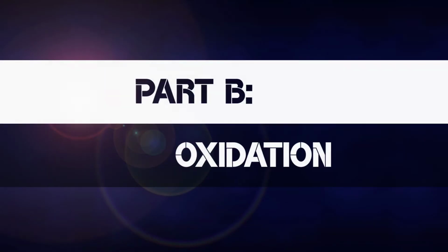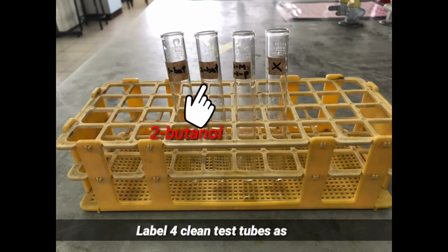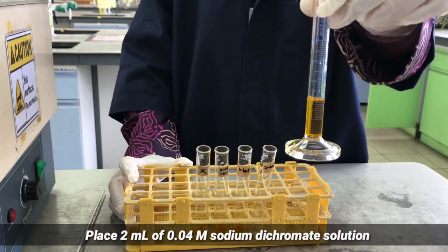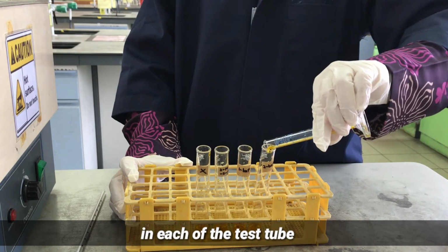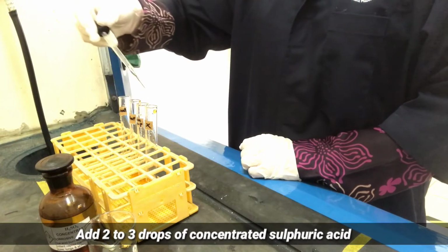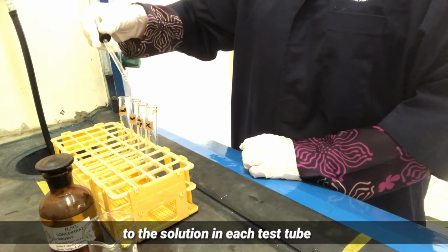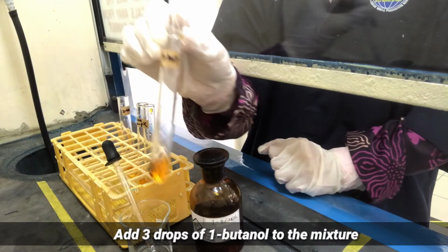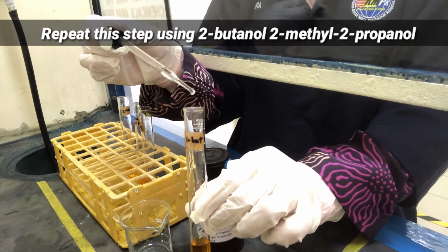Part B, oxidation. Label 4 clean test tubes as 1-butanol, 2-butanol, 2-methyl-2-propanol, and alcohol X. Place 2 ml of 0.04 molar sodium dichromate solution in each of the test tubes. Add 2 to 3 drops of concentrated sulfuric acid into each test tube. Add 3 drops of 1-butanol to the mixture. And repeat this step by using 2-butanol, 2-methyl-2-propanol, and alcohol X.